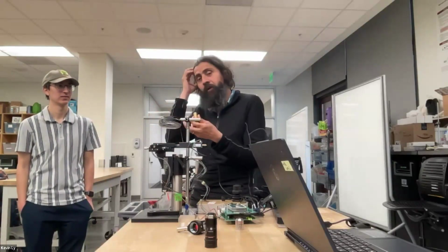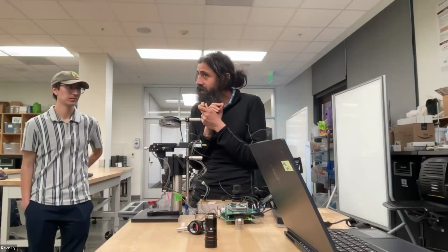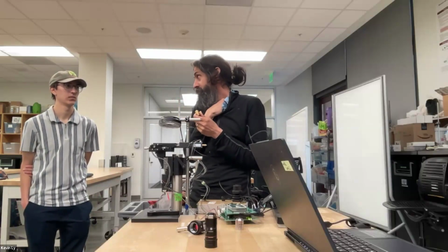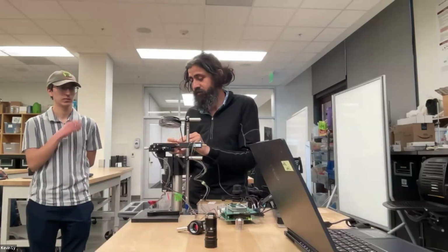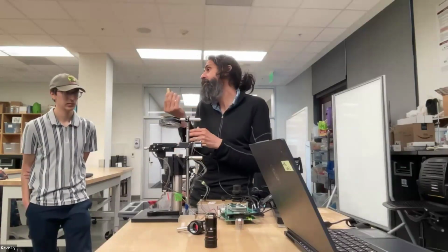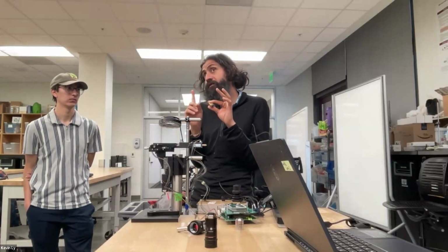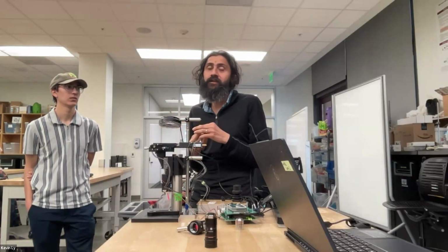Lots of people have tried many robotics, so you can get 90% there with robotics, and still every lens that most reputed lens makers make in microscopy is hand tested and is tuned. And sometimes there are little shims, and then they do interference patterns. So this is really why objectives cost so much money. You can buy an objective that would be around $10,000, one single objective, because of just the precision that was needed to get that level.